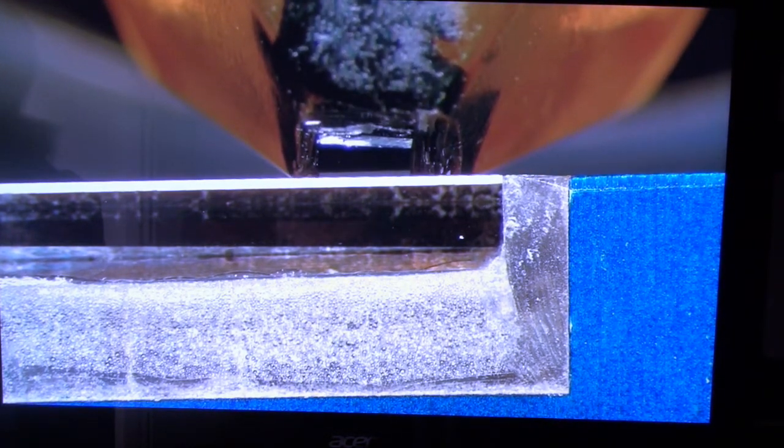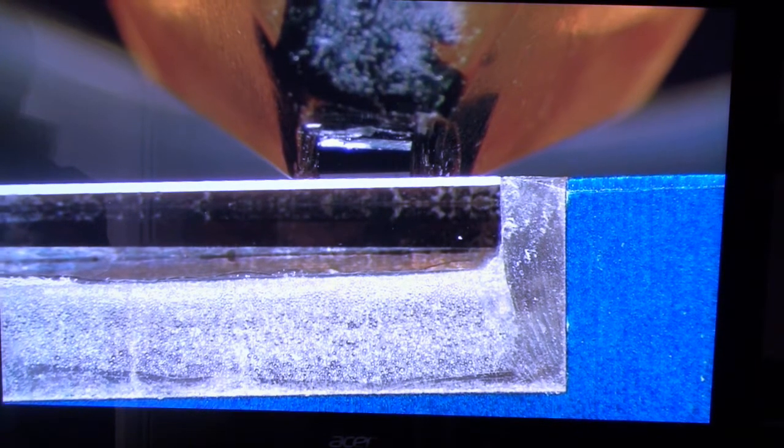So I'm going to readjust my specimen arc. And you're going to be doing this a number of different times. There's several iterations that's good to go through. Now that reflection looks pretty even all the way across. And it's staying relatively the same thickness. But I'm still a little bit far away. So I will need to move closer. As you move closer, little changes are more evident. So magnification is important. So now I can see that it is a little bit closer on the left hand side. That it is still a little bit closer on the left hand side than it is on the right. And my block is slightly rotated.